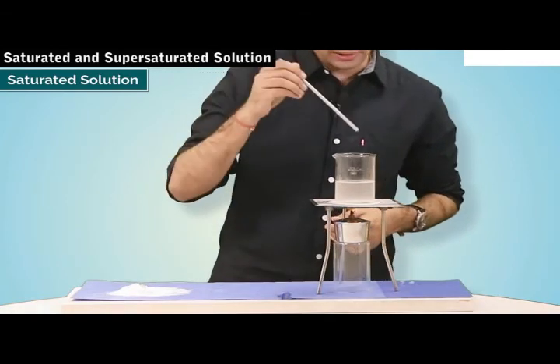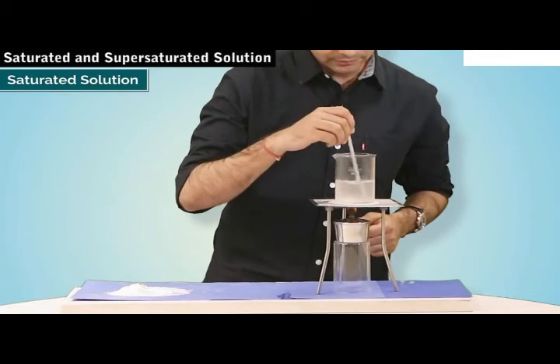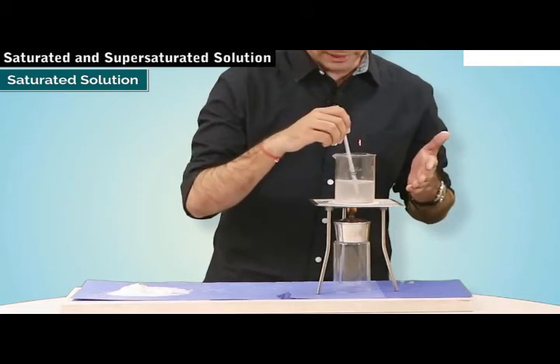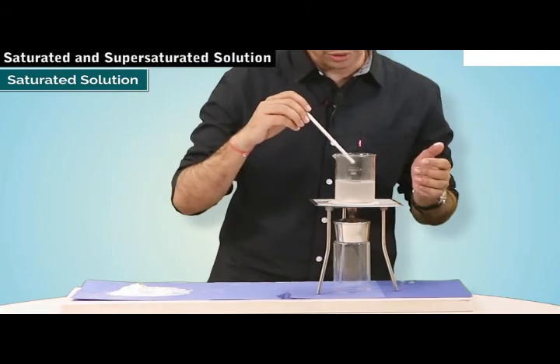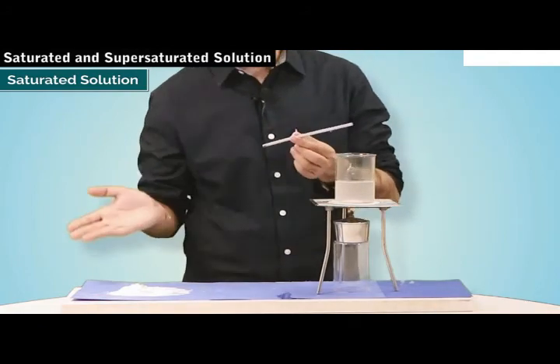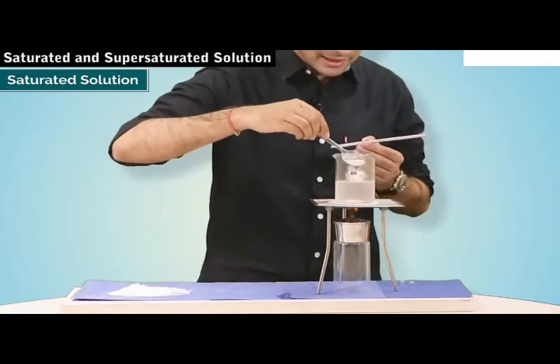And again, let's just stir this a bit. So there you can see that even if I added more salt to it, it has started to dissolve. And in this way, we can keep on adding salt and stirring it to dissolve it in this solution.